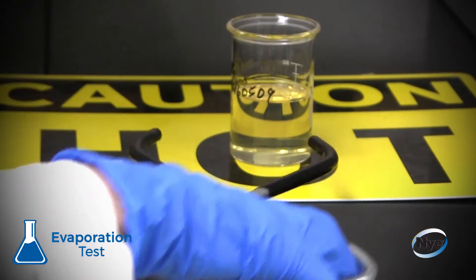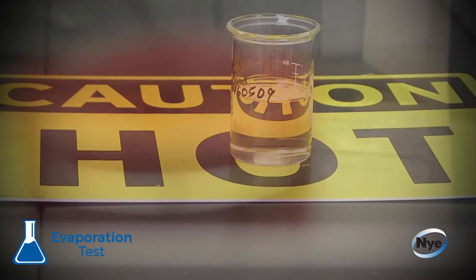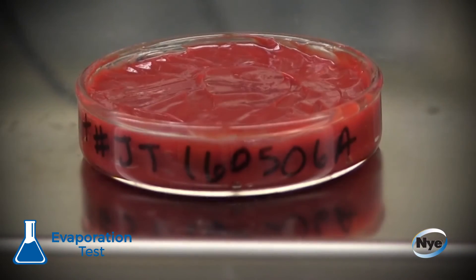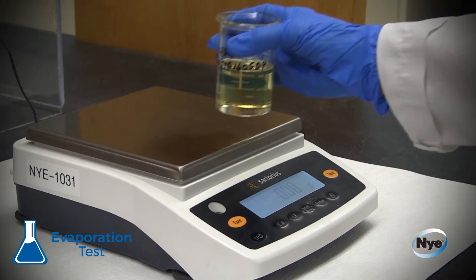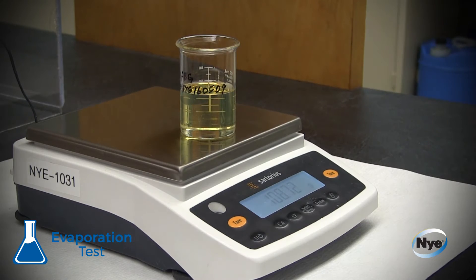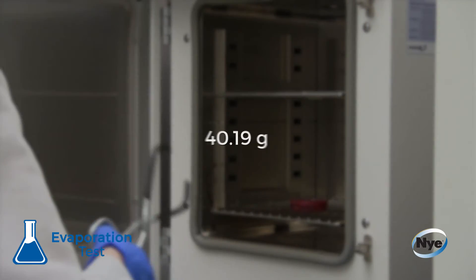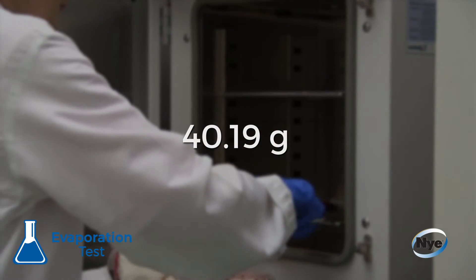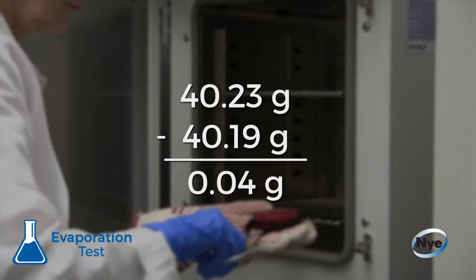After 24 hours, the sample is removed from the oven and tested to examine the mass loss from the sample. The technician weighs the dish or beaker and records the number.